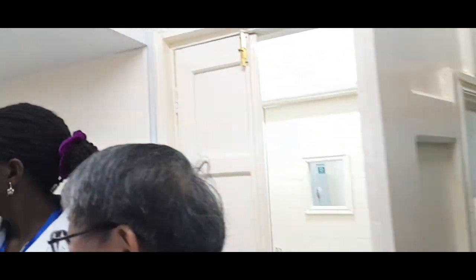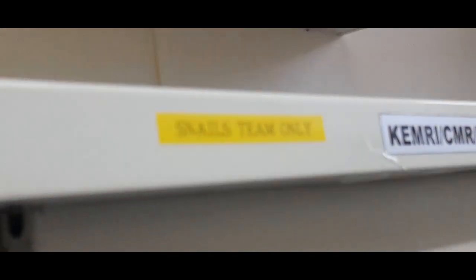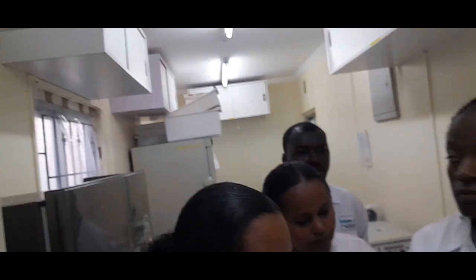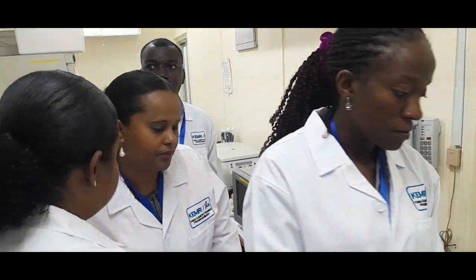Only schistosomiasis? Schistosomiasis and then trypanosomiasis. Trypanosoma, the tsetse fly is the vector, right? So after the identification of the tsetse fly, the sample is kept in a minus 30-degree freezer. Then Dr. Kambe is detecting what type of trypanosoma parasite exists. Okay. Let's go.